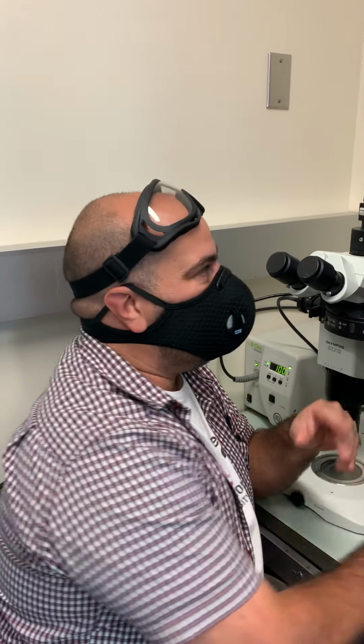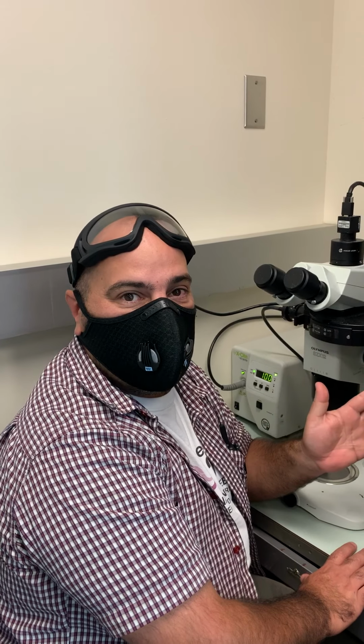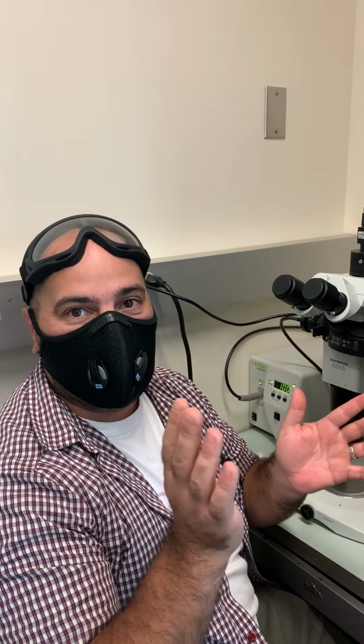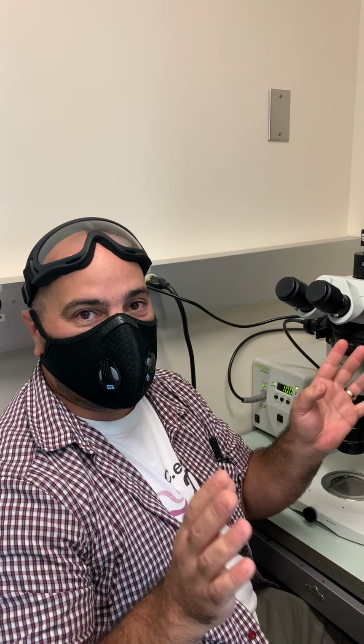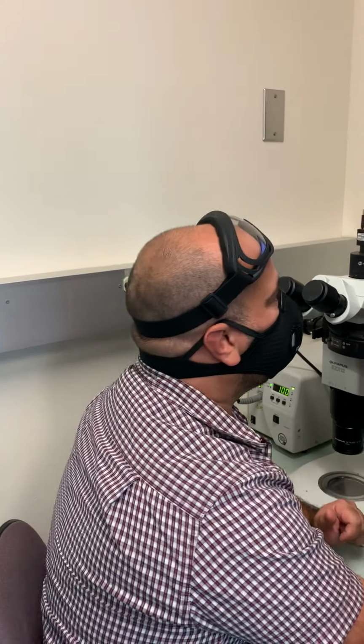So you can divide 373 by 15. That will tell you how much time goes between each frame, all right? So however many frames you have, that's how long it took the computer to go 15 seconds. And you can figure the times after that, okay?